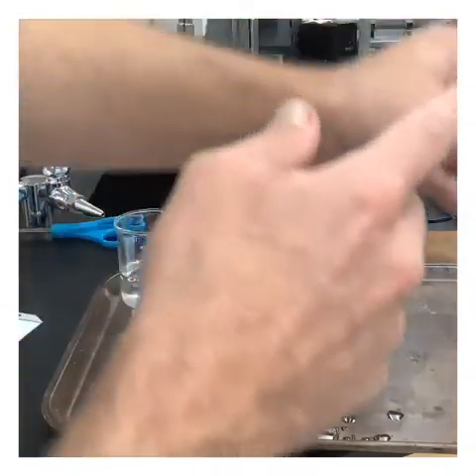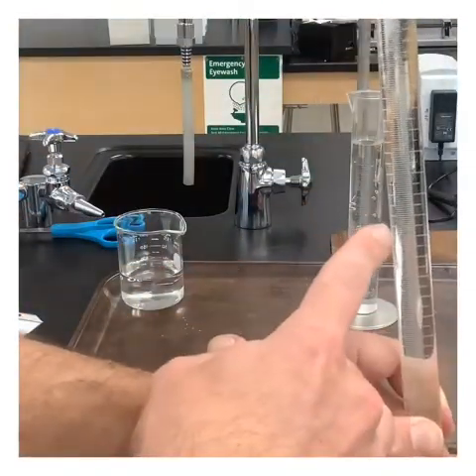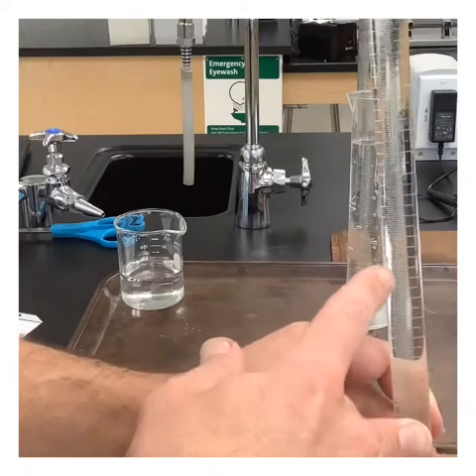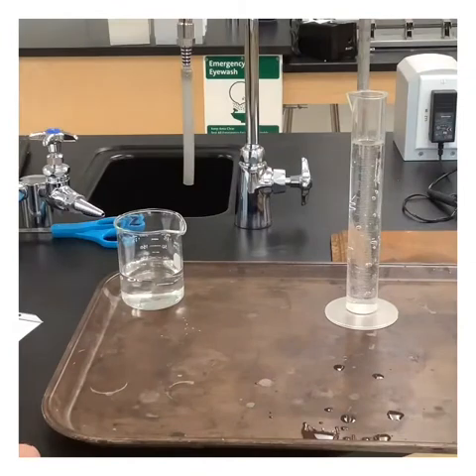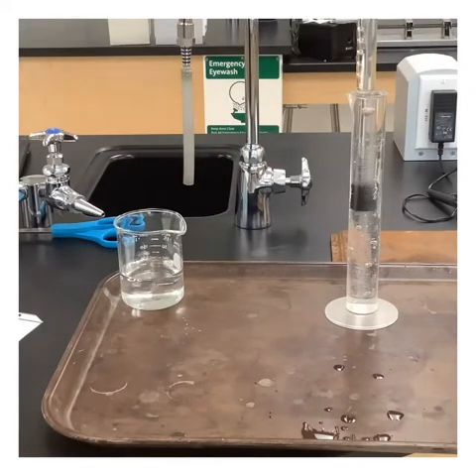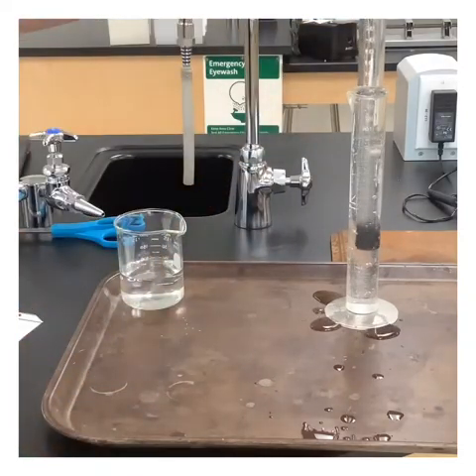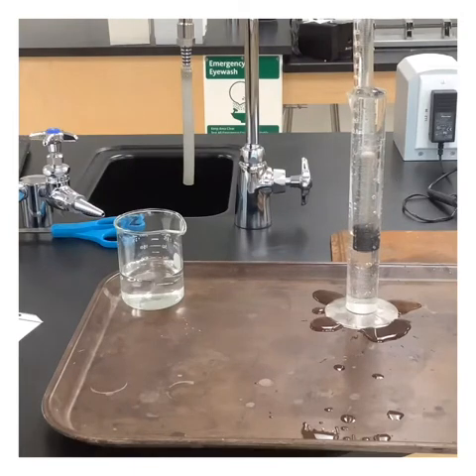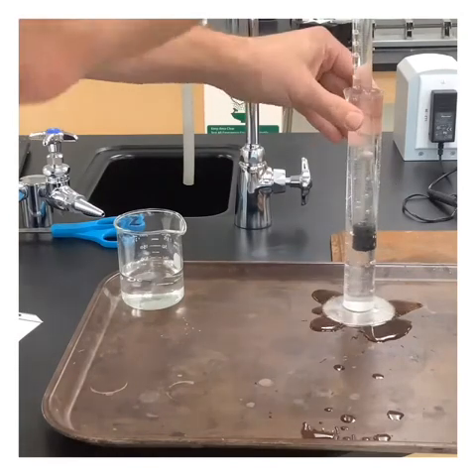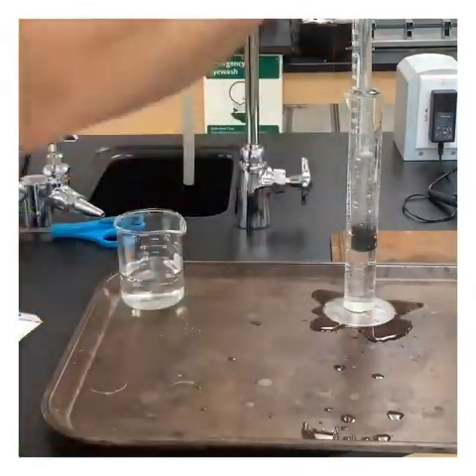But if we look closely in the camera, I don't know if we can see this. Do you see the waves? Look at all these waves coming down. That's the HCl that's traveling down. And so what I'm going to do is put it in here. Okay? And I'm going to clamp it. I've got it in the tray here so I don't make too big of a mess.